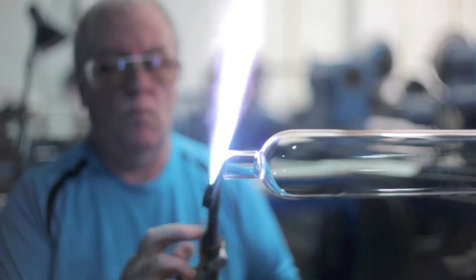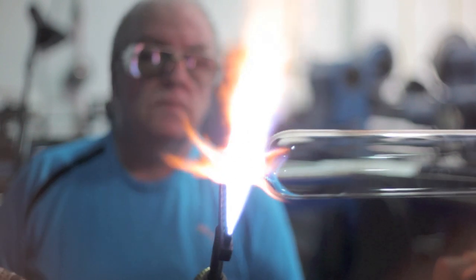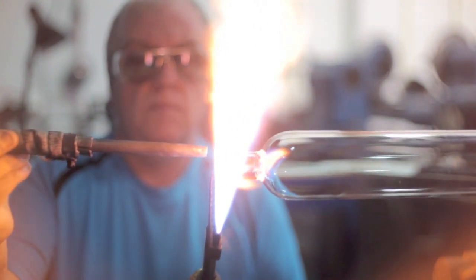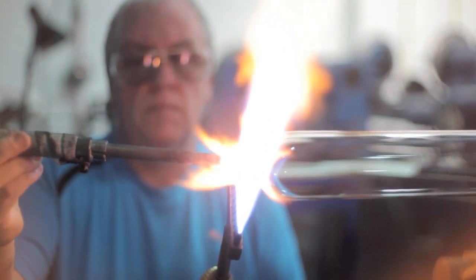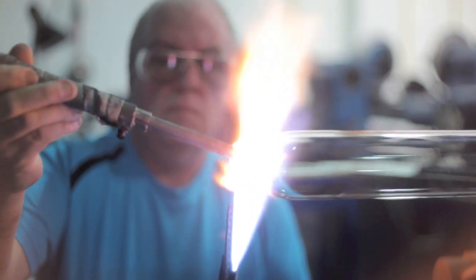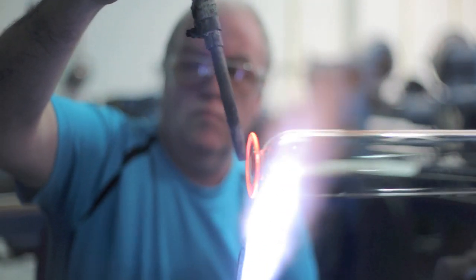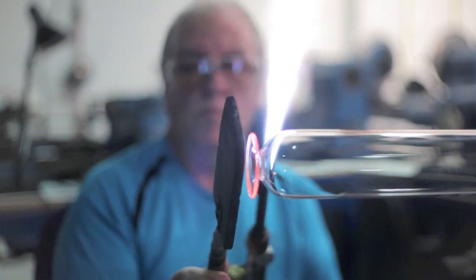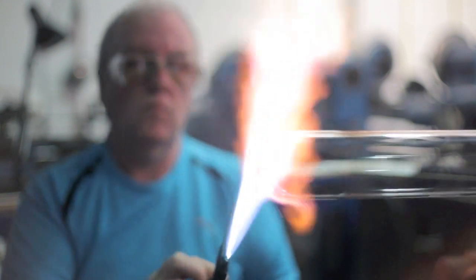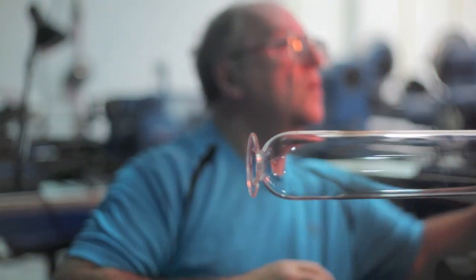The carbon tools won't stick to the glass. So we have got a carbon reamer in there. Put that inside and flare it out. There we go. Just got to make sure it is nice and flat so it stands up straight without wobbling. Just got to make sure the beaker foot is the right size. There we go.